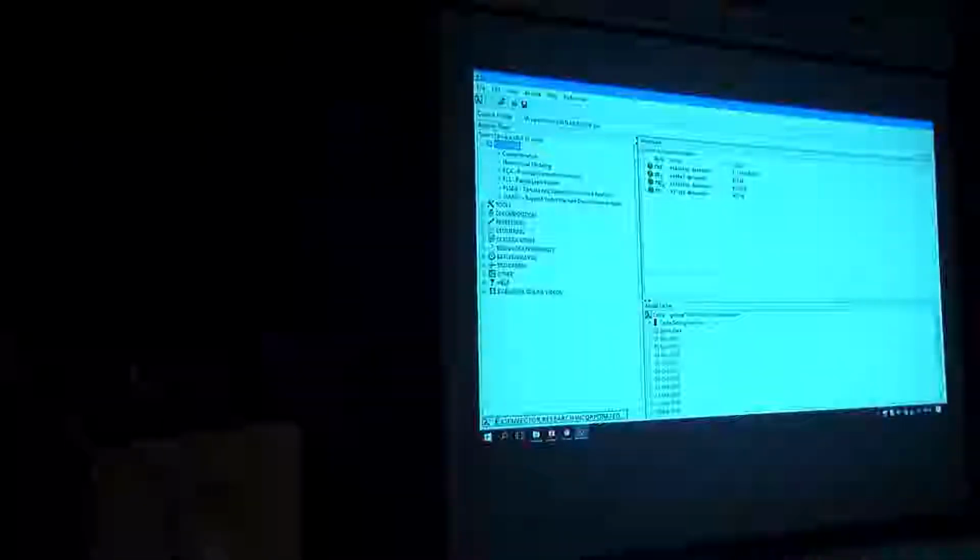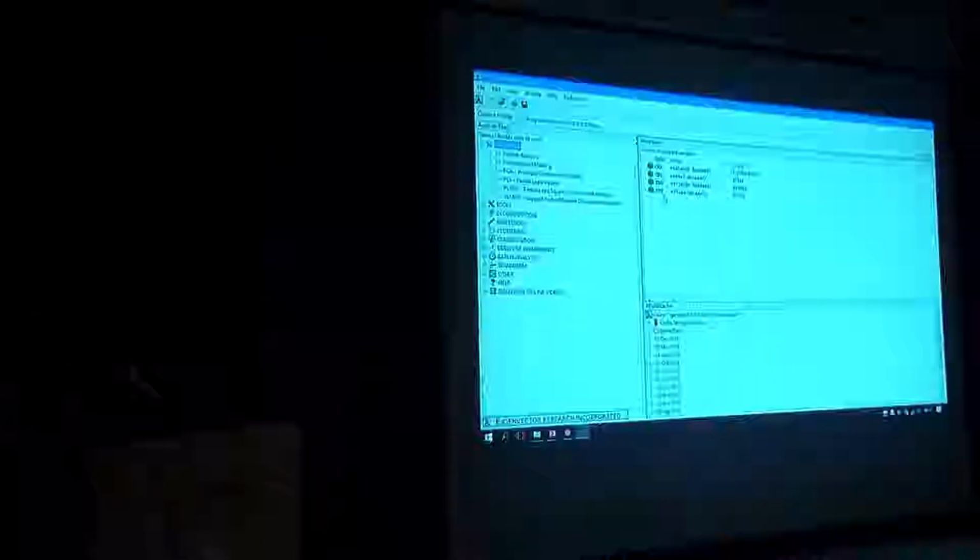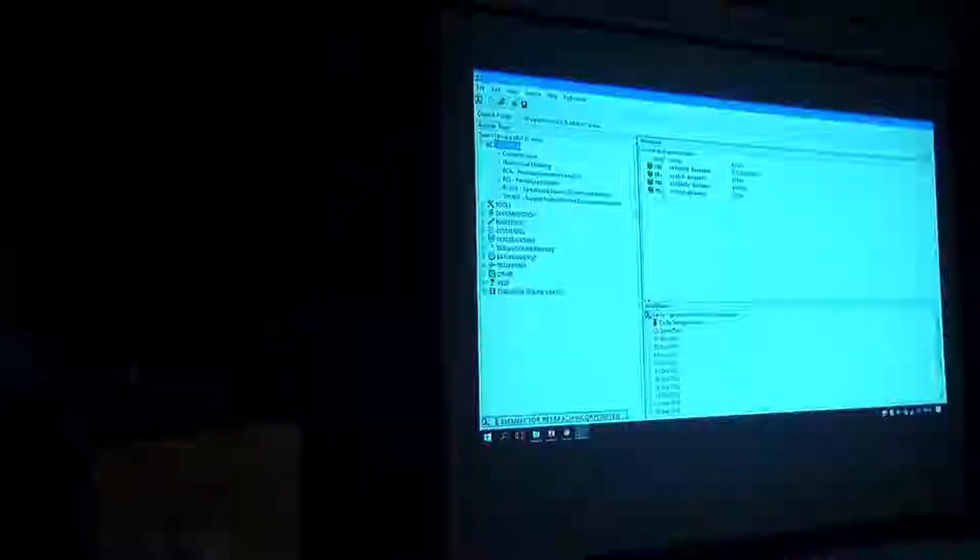And this one is Y. So the concentration data for calibration are in CRY. T is test, so we can test the data set if you have time. I'll show you how we can predict the test set. Again, X for spectra, Y for concentration. For the competition, there is also a validation set, which I haven't included in this workshop.